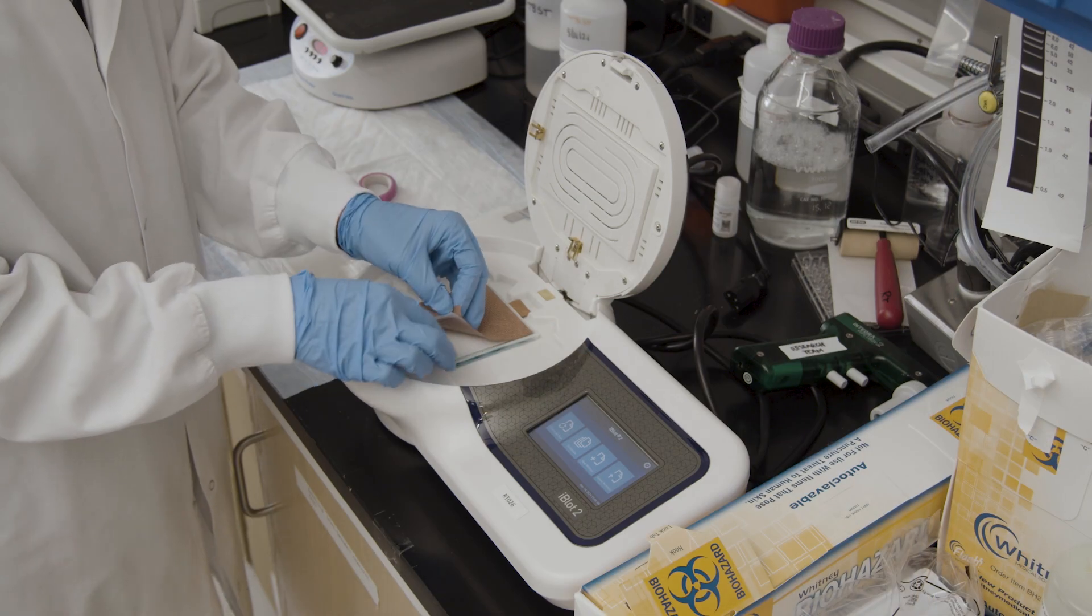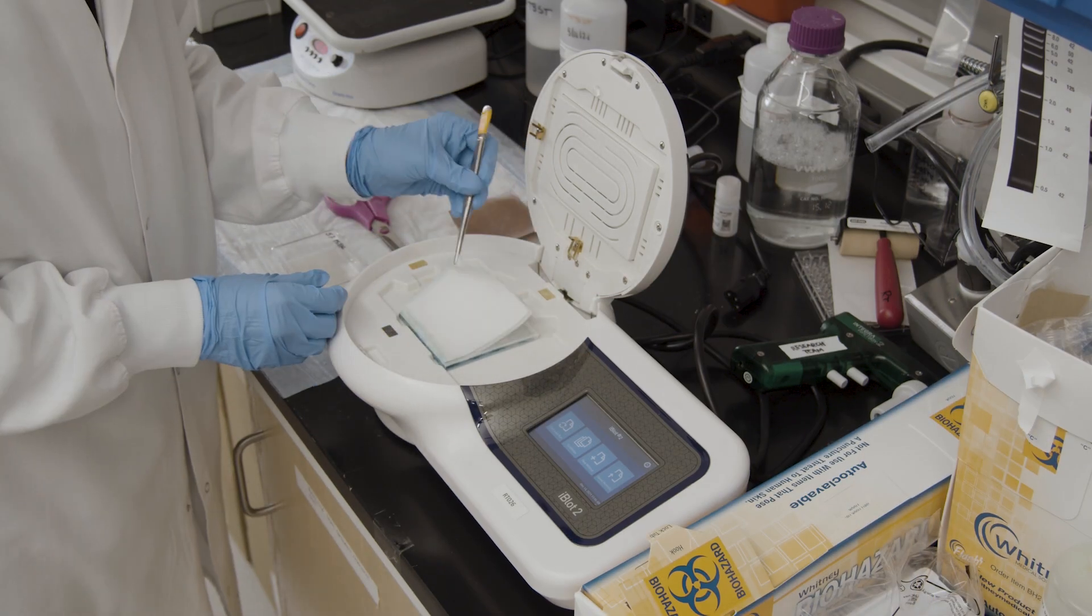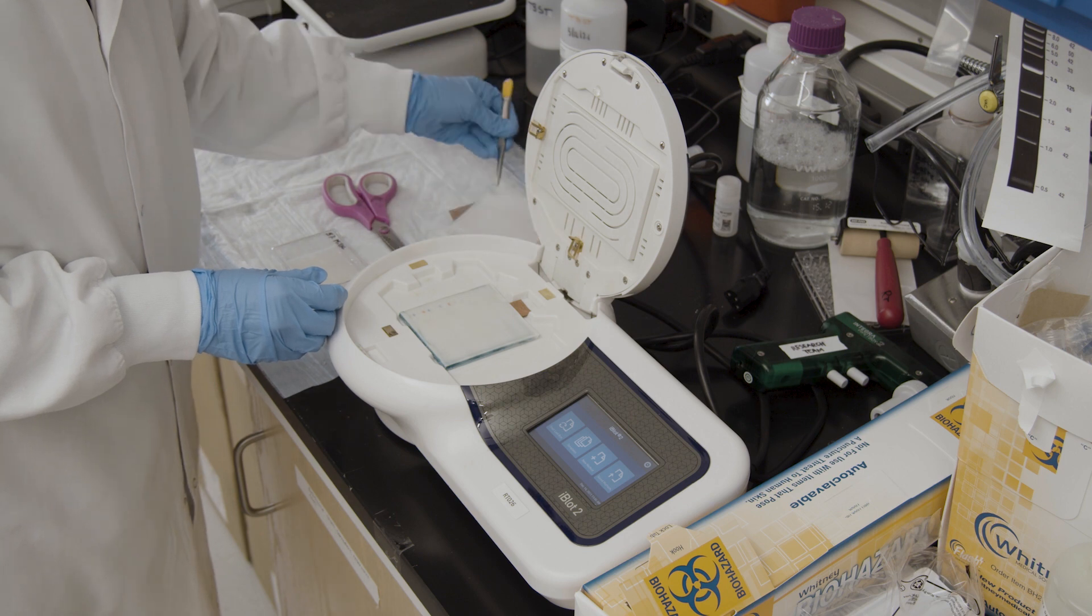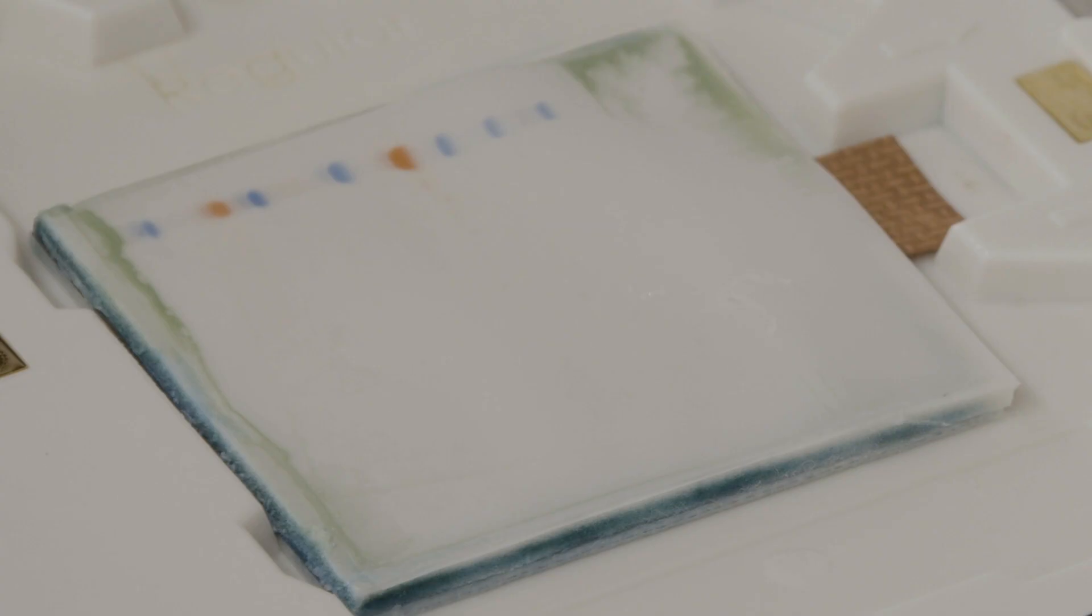Once the program is complete, carefully remove the top stack and discard. The protein ladder should now be visible on the membrane, indicating that the transfer was successful.